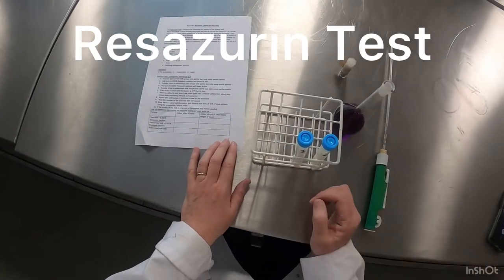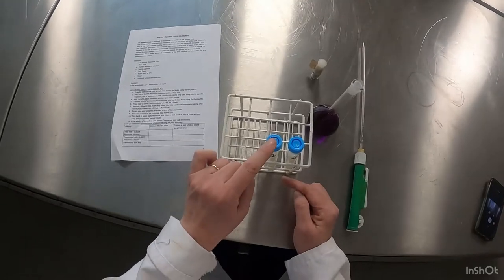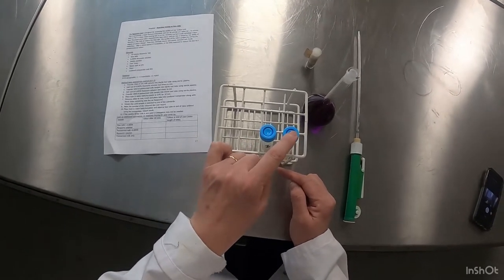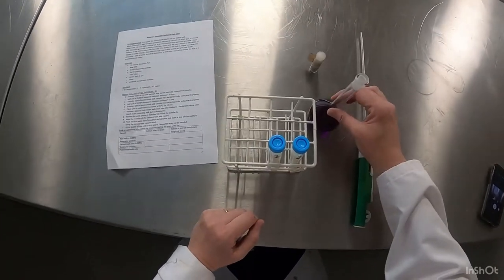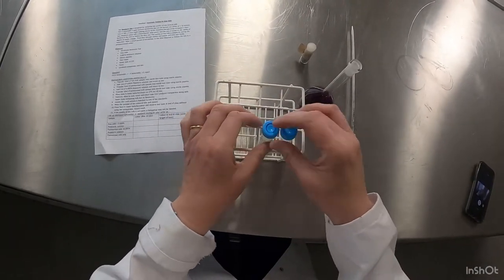This test is called the Resazurin test and it's looking for the quality of the milk. I have two samples in front of me, sample 1 and sample 2, and I have a solution of Resazurin. There's about 10ml of sample 1 and 10ml of sample 2.